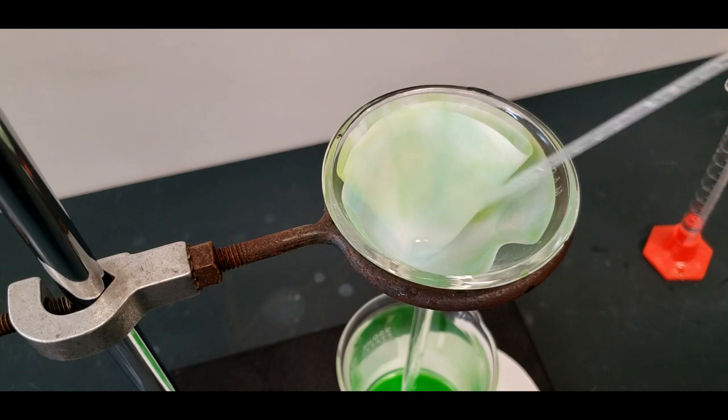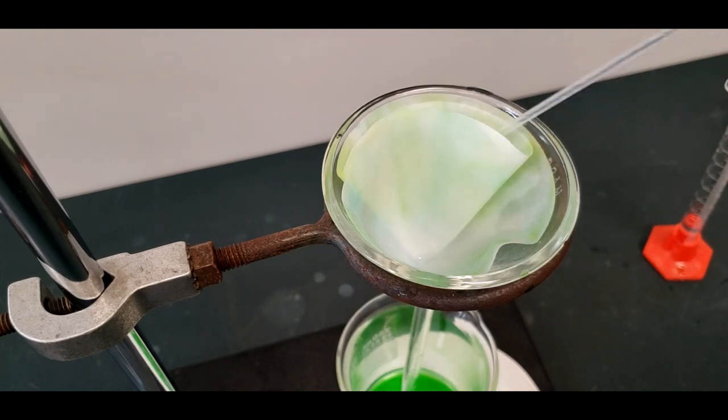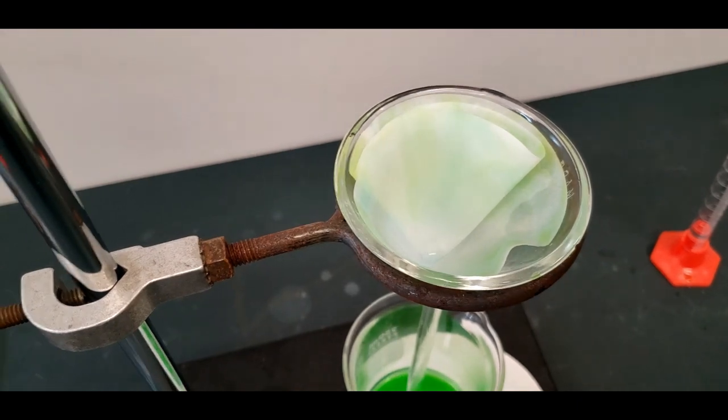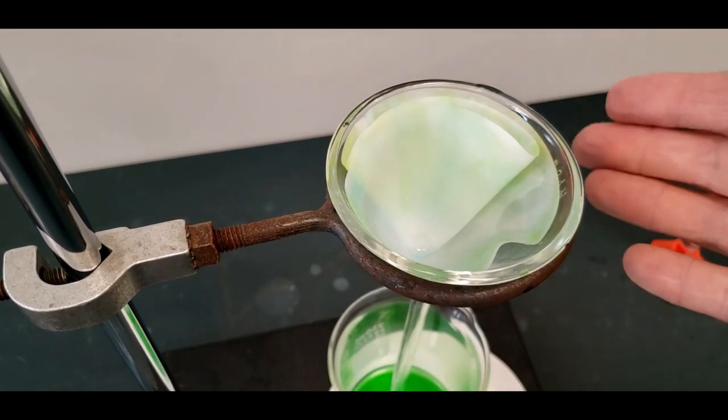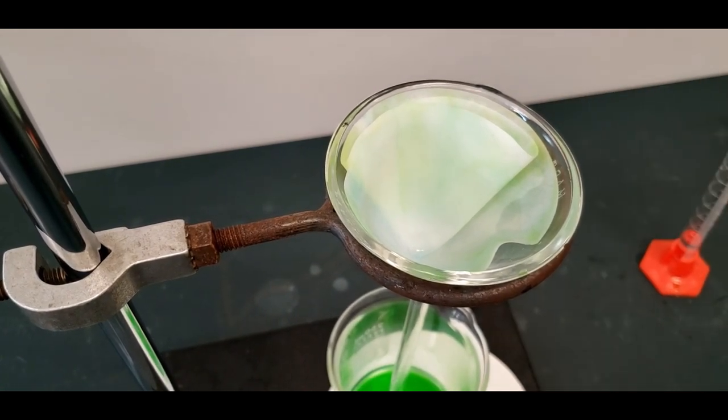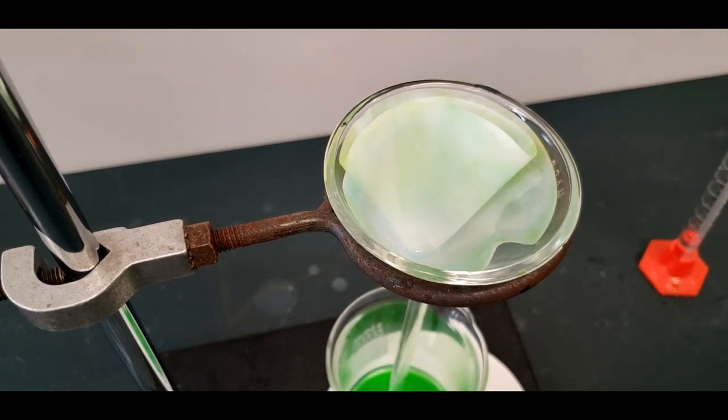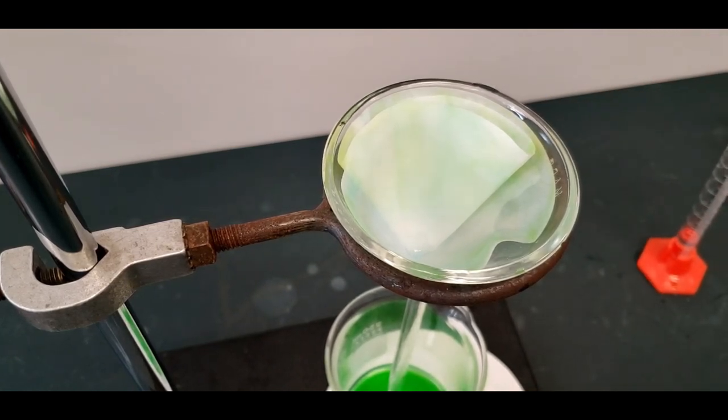Use as little water as possible, say five mils. You can go a bit higher, but you don't want to put in even 10, that would be a little too much for this. I would say this is fairly good. There's very little of the green left, but I'll put another one or two mils through just to be sure.